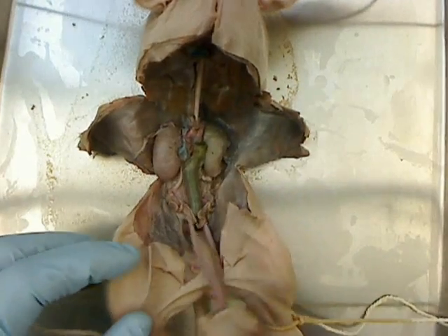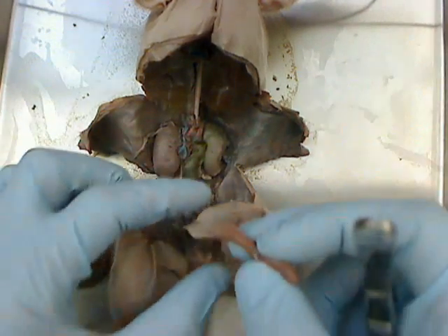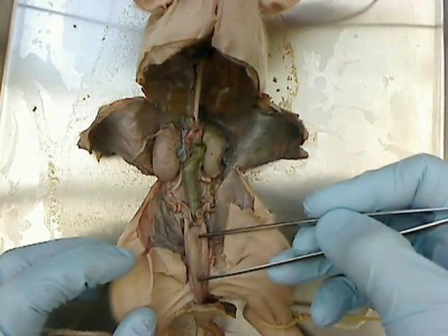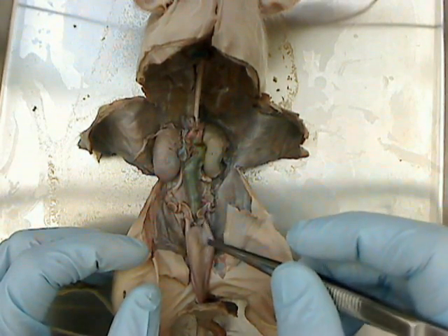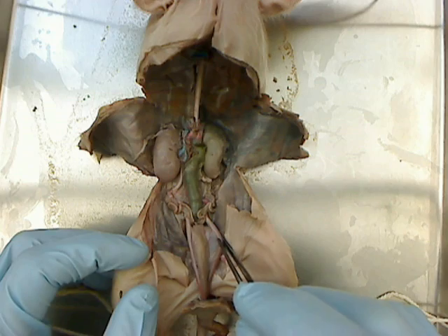If we look inside, this is actually the umbilicus — it was dissected away, it was up here and then reflected back. This structure is actually the urinary bladder. In the fetal pig it's rather long. In the adult pig, as it's being used, instead of becoming long, it becomes rounded. On either side of the urinary bladder are the right and left umbilical arteries.